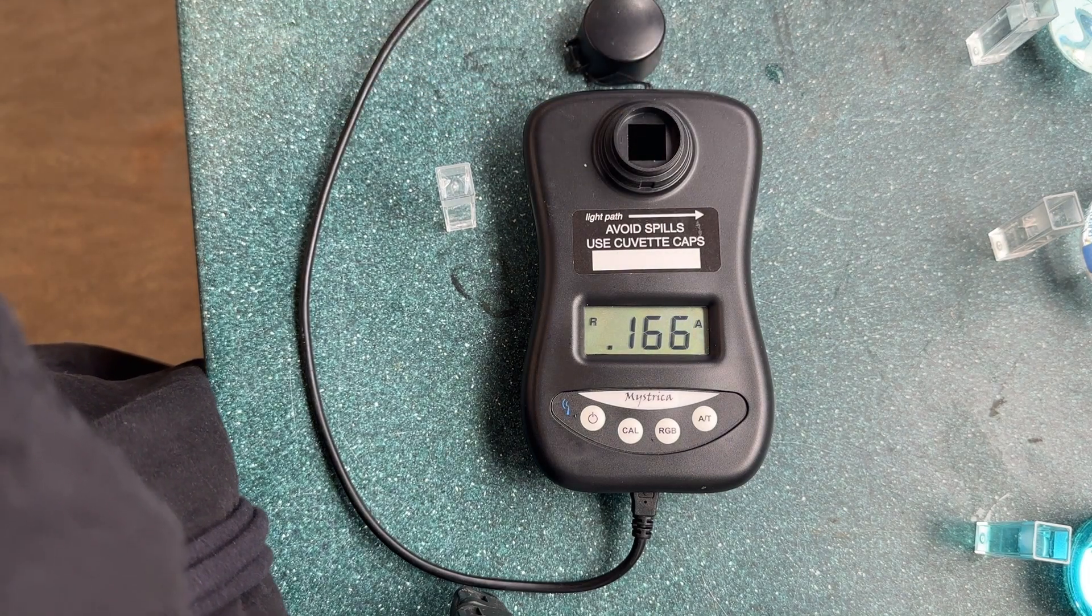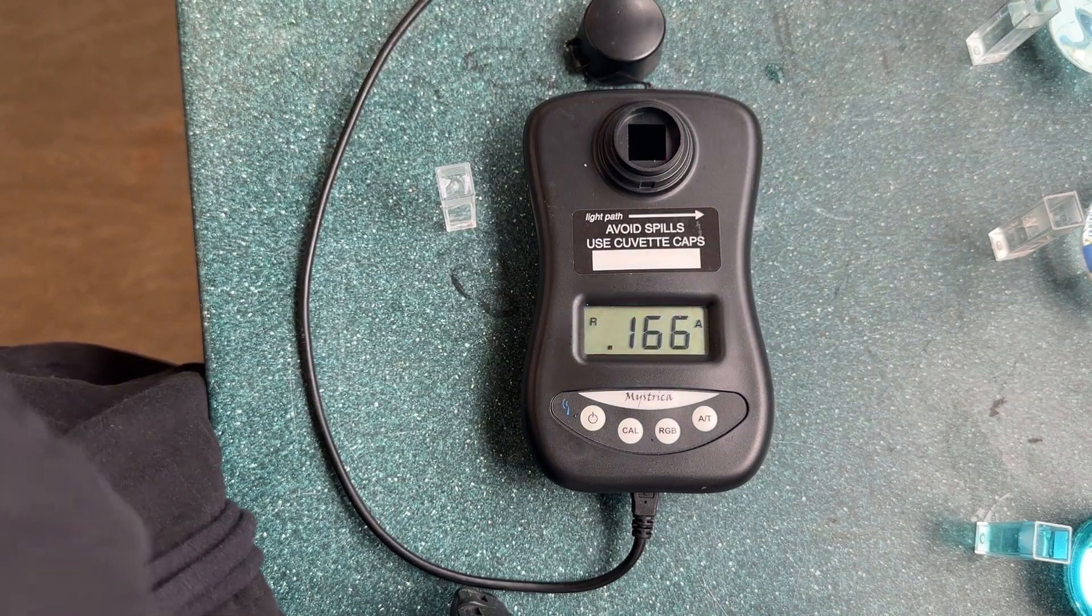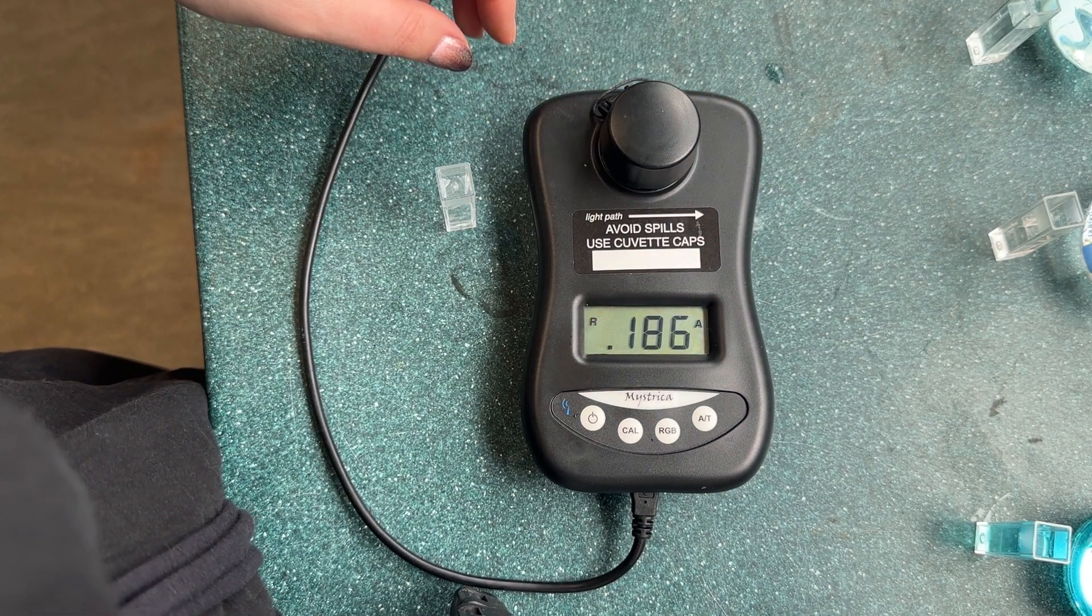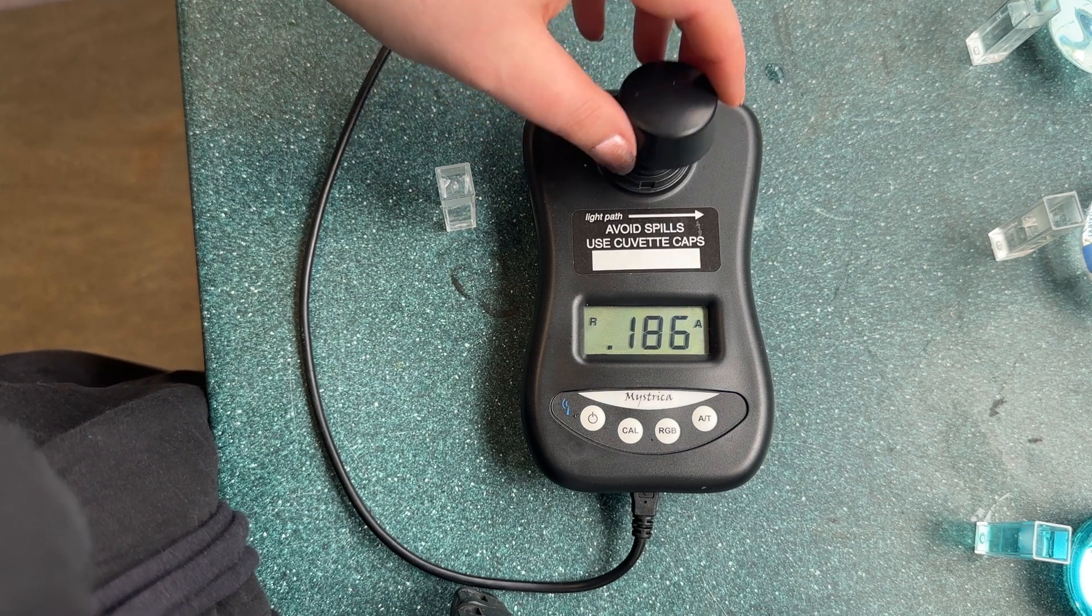We then take our next dilution which had a concentration of 0.2 moles per liter. And this has a reading of 0.186.